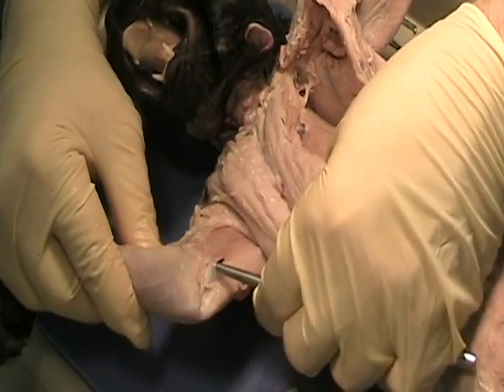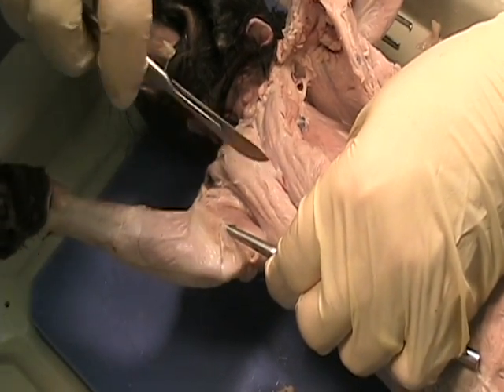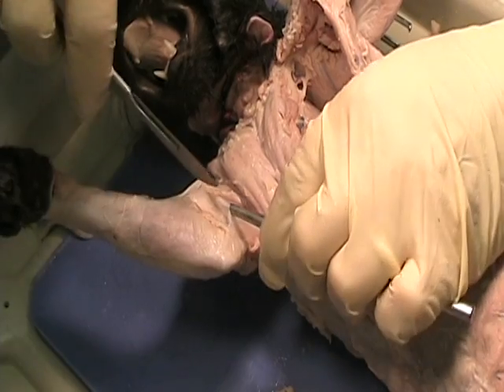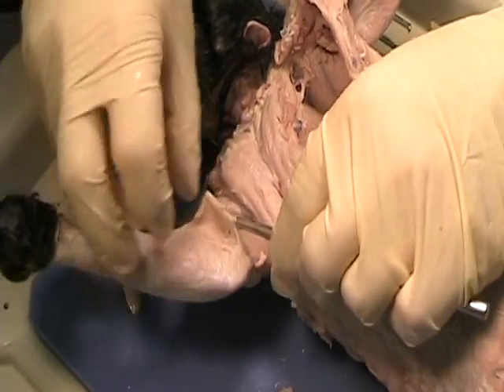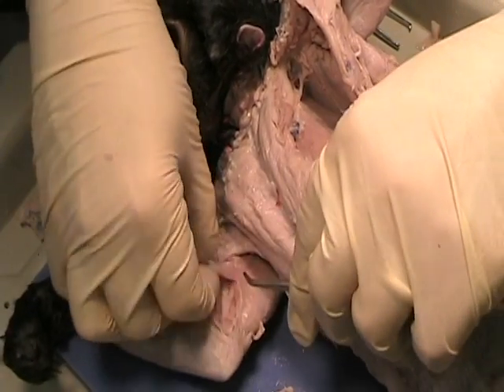You can see I'm up underneath all this fascia here. I'm going to go ahead and take a scalpel and just cut very lightly right along here. Then I can take this muscle and remove it.